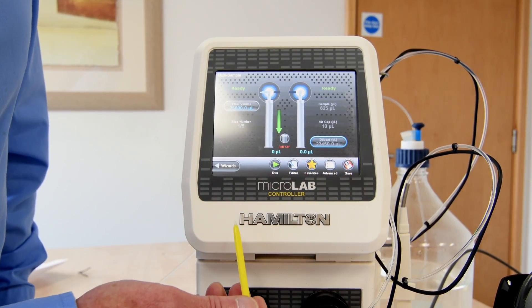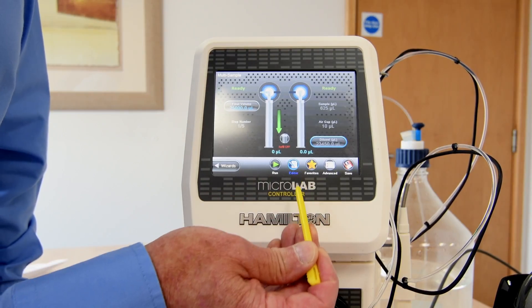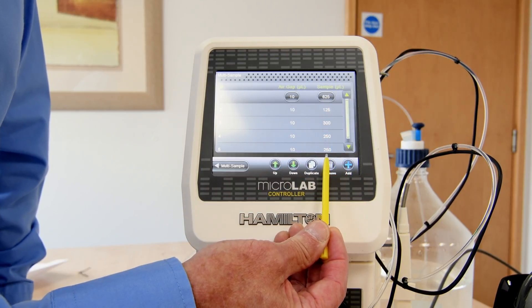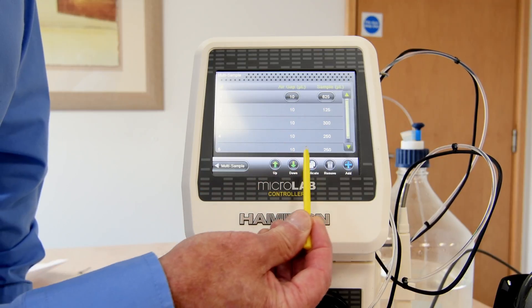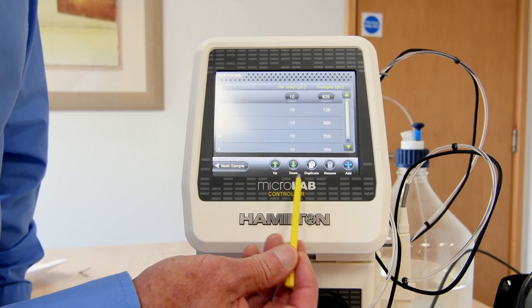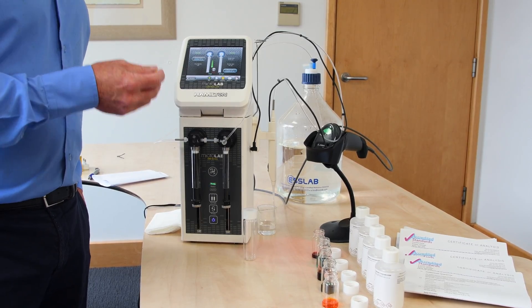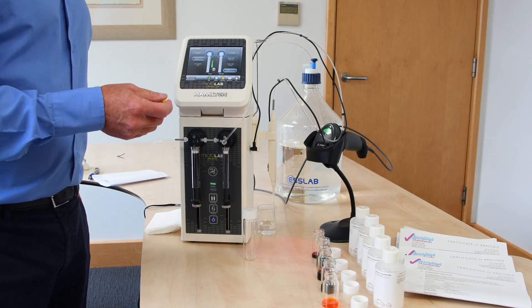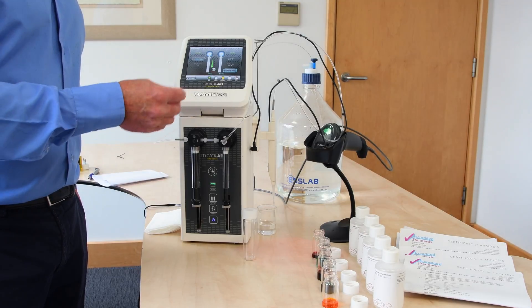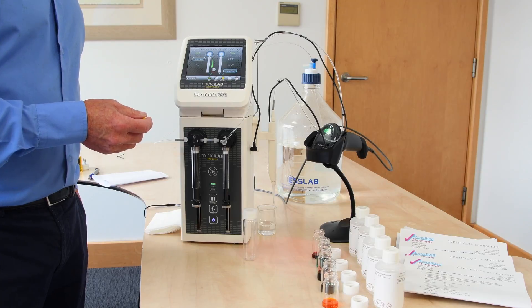We've completed programming the wizard. Looking at this edit function, it allows us to confirm the volumes we're going to be aspirating along with the air gaps requested between sample additions. The wizard format gives us a straightforward and simple way of preparing a standard: we work out the concentrations we want, aspirate the amounts of each sample, put in air gaps, and produce a complex mix of a multi-element standard.